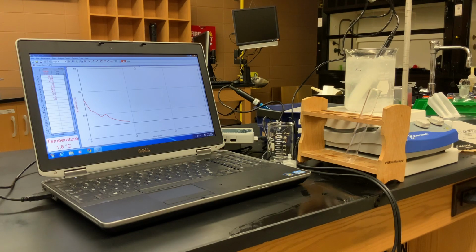So to determine the melting point, once we're done determining the freezing point, all we're going to do is take the test tube out of the rock salt ice mixture. We're going to just place it in the test tube rack at room temperature. We're going to leave the probe in, and then we're going to start a new graph. And this time we'll be seeing our temperature start at a very low temperature and then increase to room temperature. And then we're going to note the point at where all of the solid biodiesel turns back into a liquid. And that's going to be our melting point.